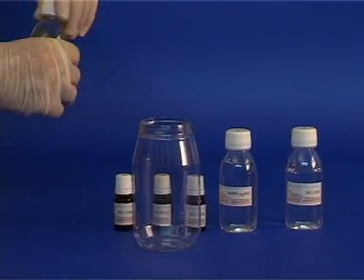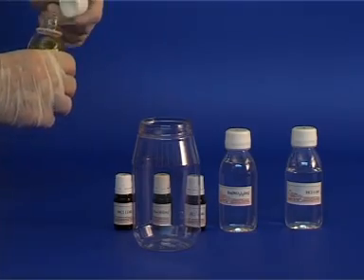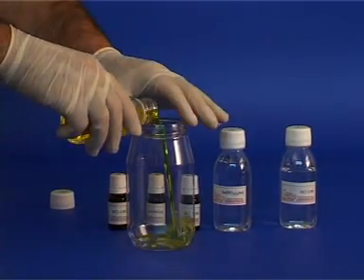Take bottle 1 and pour its contents into the reaction container. Note the yellow color.